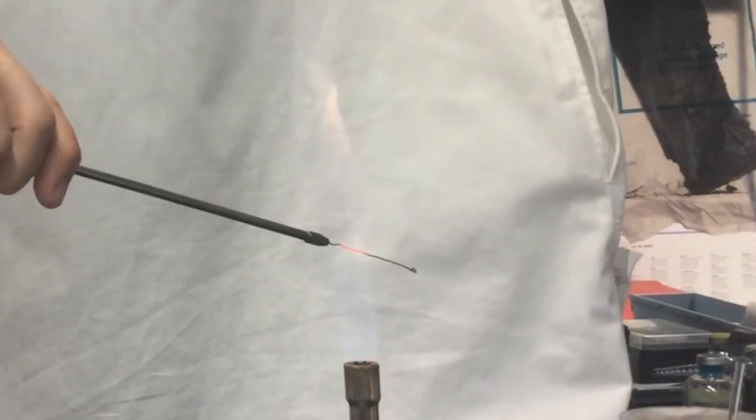Allow the flamed tool to cool for a few seconds in the air. Then repeat the flaming. Do not put the flamed tool down on the bench. Keep hold of the tool close to the flame to help prevent air contamination from landing on the flamed piece.